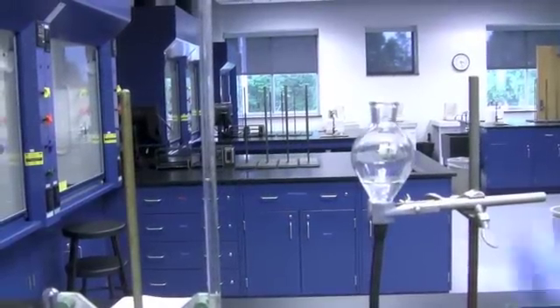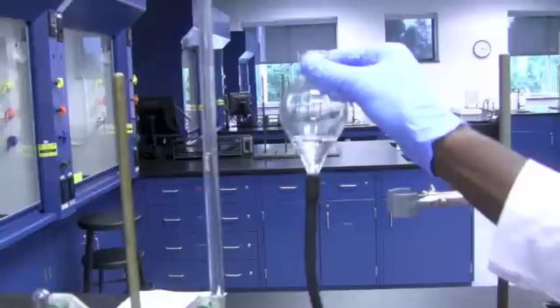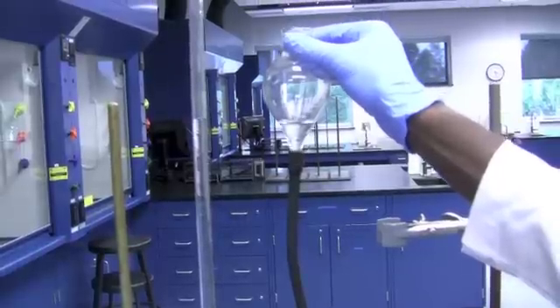Now this is how you check for leaks. The water level in the bulb and the buret should be even, and this indicates that the pressure is also the same.